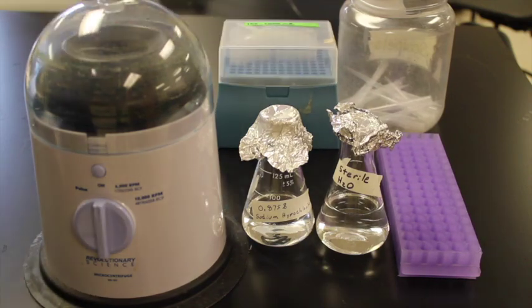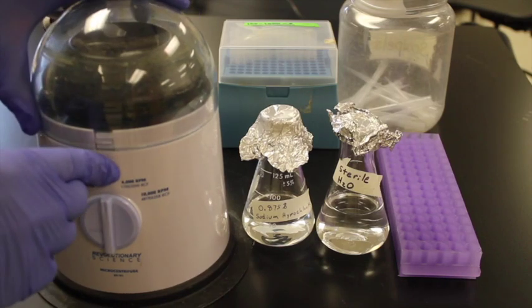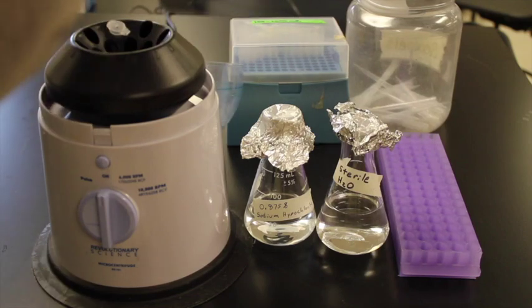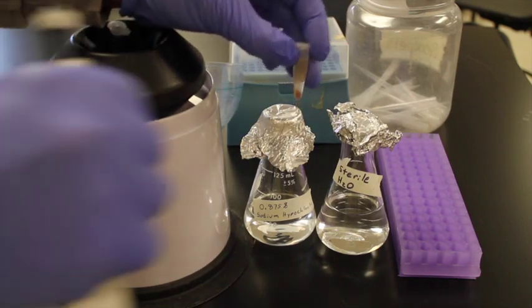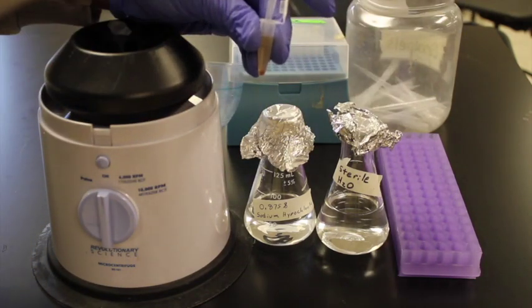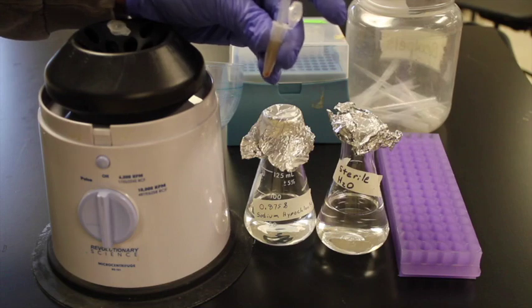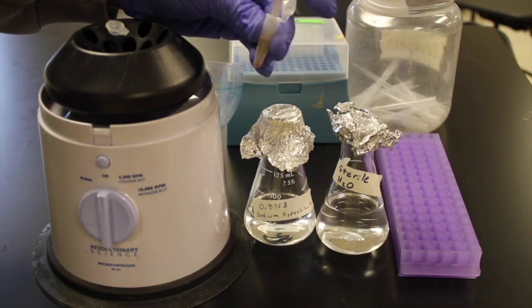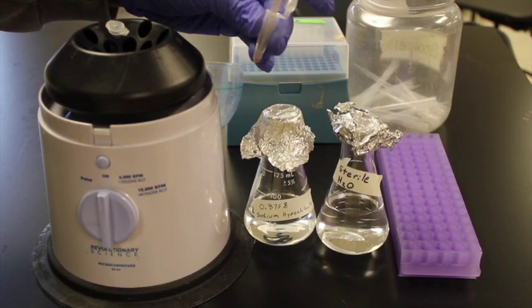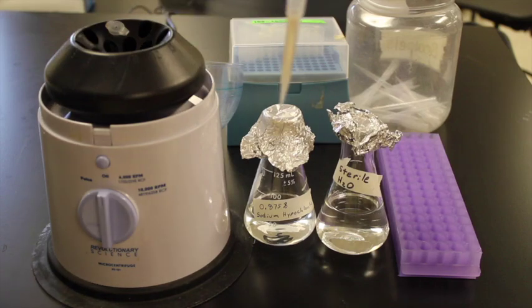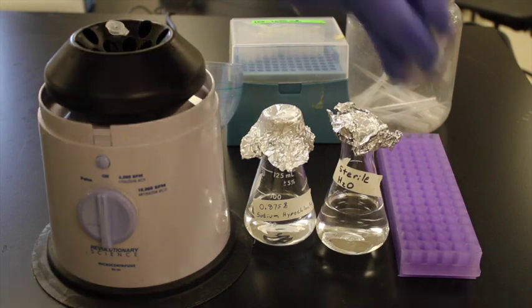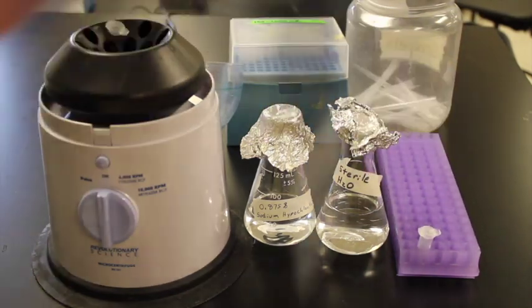Grab another pipette tip and then we will open this up. And then you can see here is our tube. I'm going to open that up and we will carefully pipette out the solution without sucking up the spores.